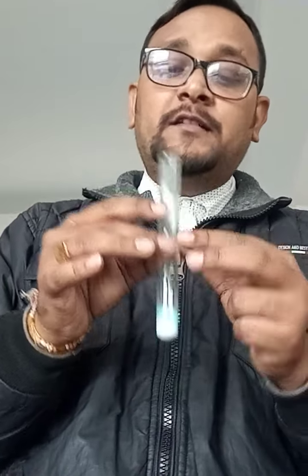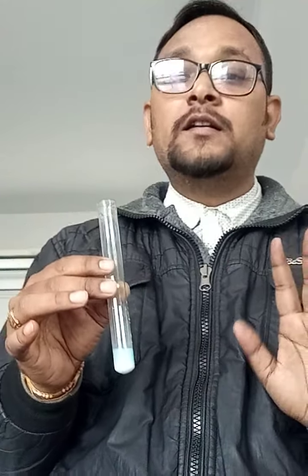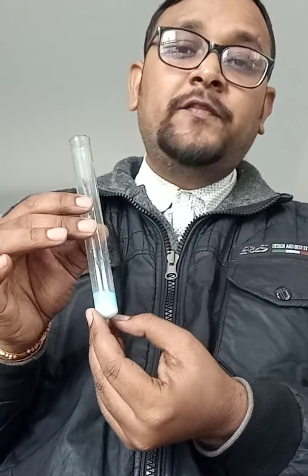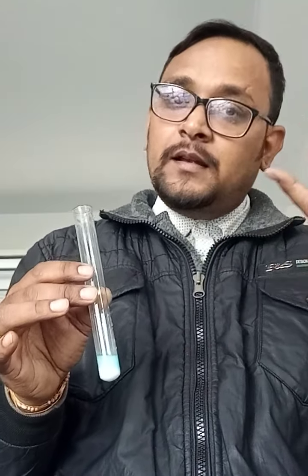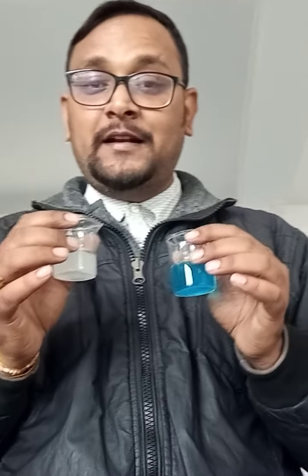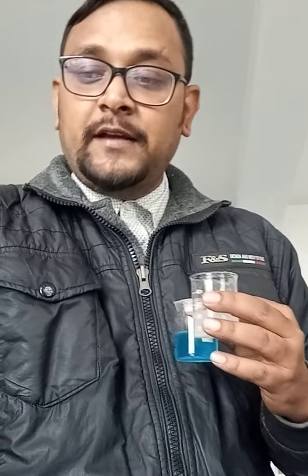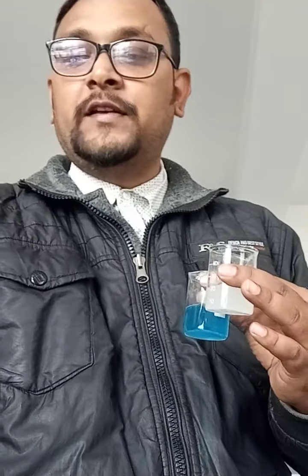Interestingly, if I try to dissolve this precipitate in acid, even strong acid, it will not dissolve, meaning it is insoluble. So this gives you the idea that some sulphate radical is present. This is the way we can analyze if there is any sulfate radical. Understood? Maybe in a small test tube it is difficult to understand, but already I have tried to show you the white precipitate here, my dear students. This is barium sulfate, BaSO4.